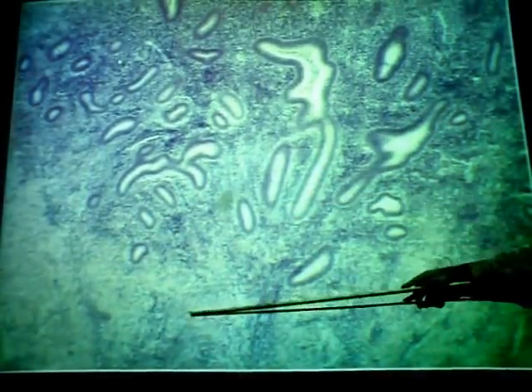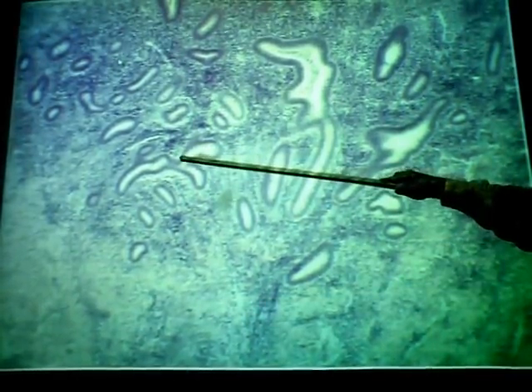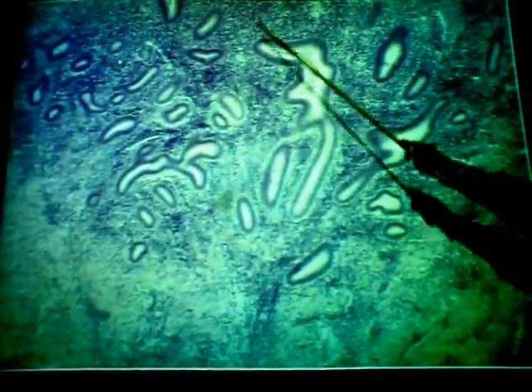And then the basal layer, right down here, adjacent to the myometrium, is the stratum basalis. It's the stratum functionalis that is sloughed off, degenerates, with the menstrual flow. But part of the endometrium remains, that's the stratum basalis. It's a source of new cells for regeneration of the stratum functionalis. So you never lose the entire endometrium, just the surface part, which usually is a thicker layer.